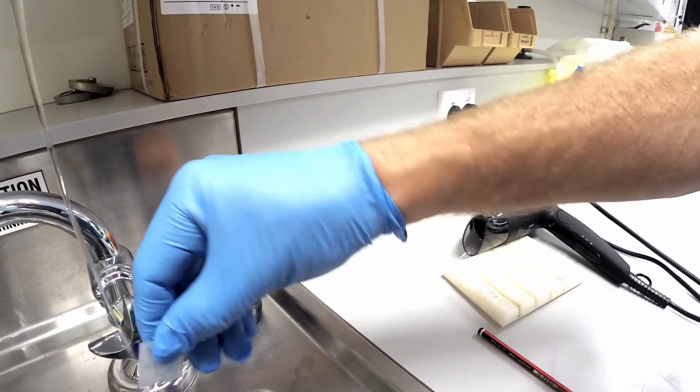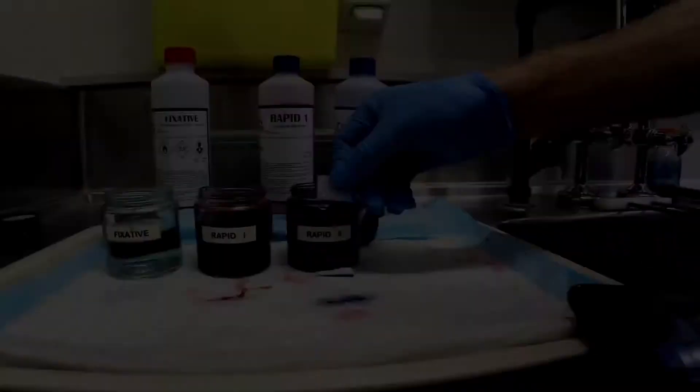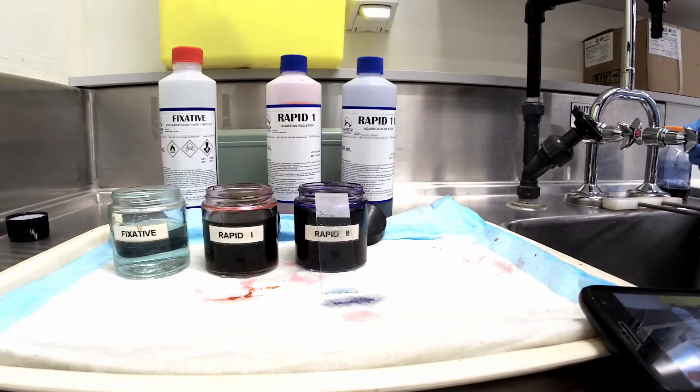Rinse off under running water and then stand the slide upright to air dry.